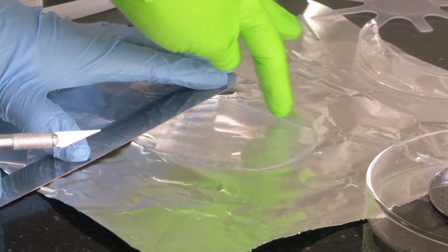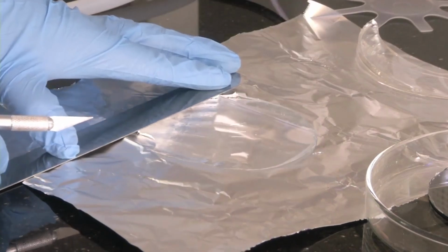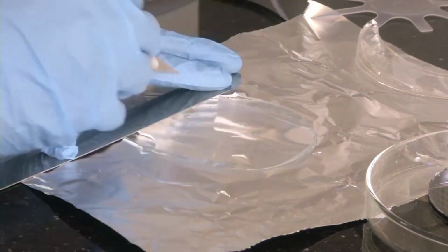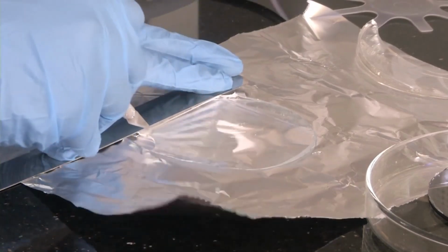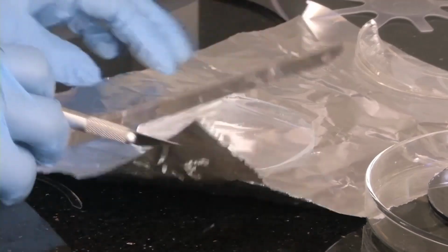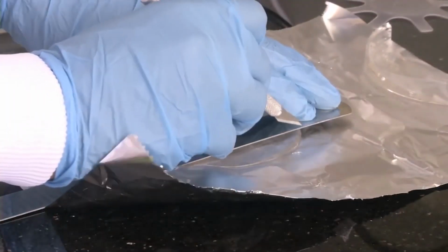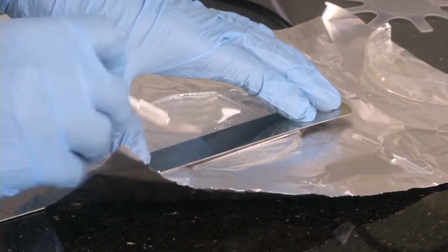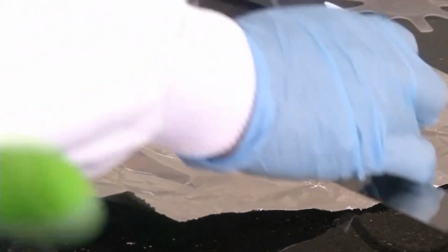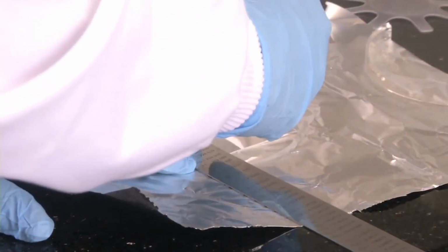We have already made a cut here to remove this piece, and now we will be making another side of the device. The device is here, and we are going to cut it out. So another dimension we have made. Once the membrane is ready and it is successfully removed from the master, it is a relatively easier task to cut it out. But remember, always be very careful with your silicon master. It is a very expensive piece of device that we have made. Once you have peeled off your PDMS membrane, then it is okay. You can just cut it out to your required dimension.